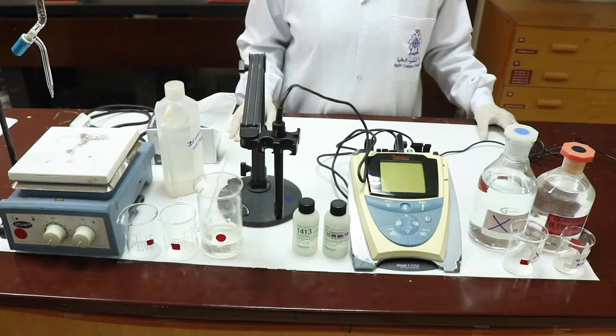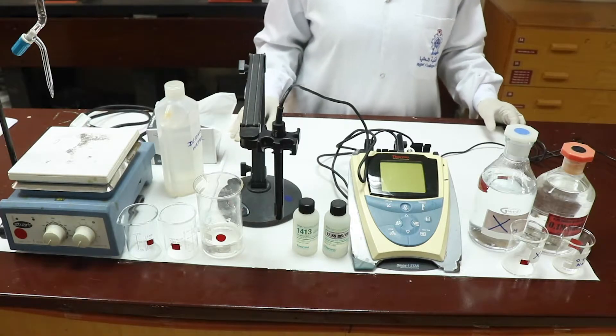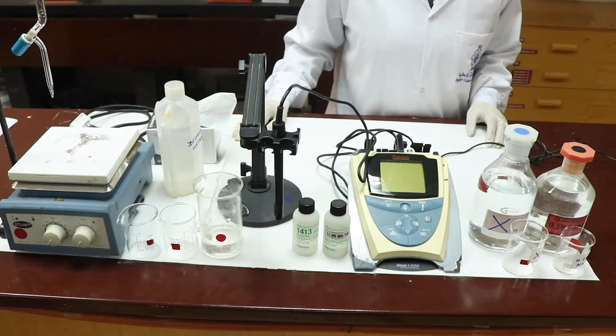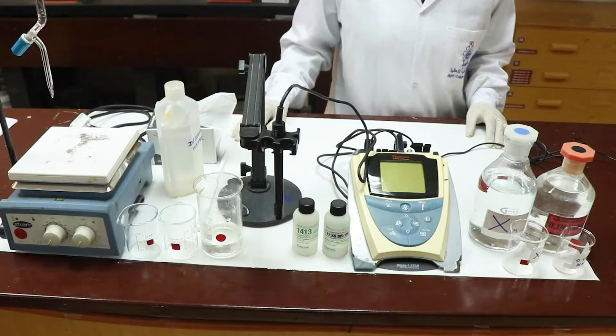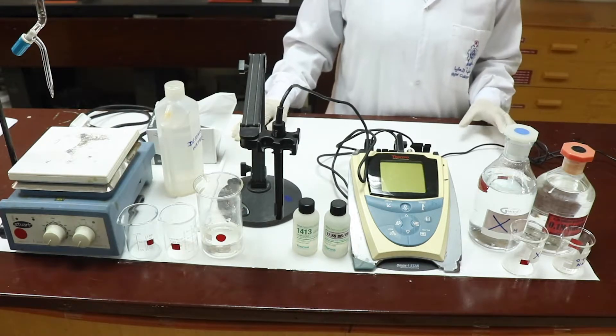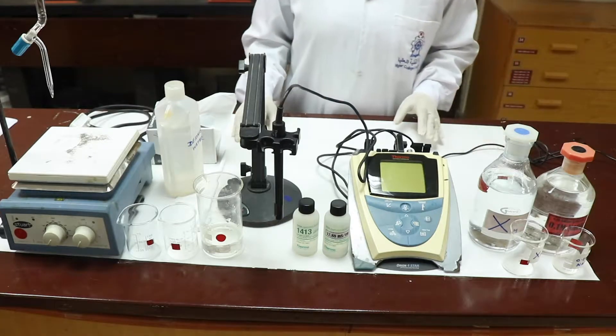The aim of the experiment is to calculate the concentration of an unknown strong acid using a base whose concentration is known to us using conductometric titration.